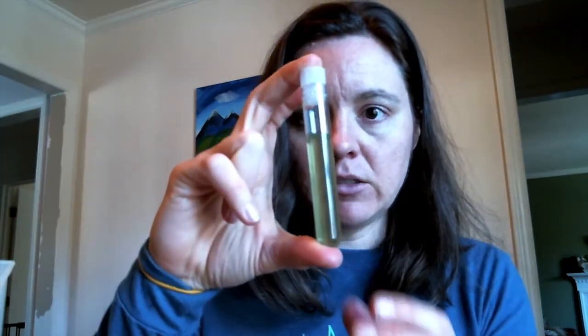All right, so once we have 10 milliliters of water in there, we're doing the pH test. So we're gonna find our tablet in our baggie that says pH on it. Again, you might have just a foil tablet that has a sticker on it that says pH, or you might have a plastic baggie that says pH on it, whatever. Doesn't really matter. So open the foil, dump the tablet in the tube, cap the tube, and you're going to mix by inverting again. Inverting is just flipping it up and down. This one tends to dissolve a little bit faster than the other one.